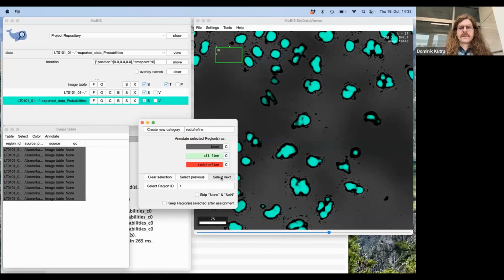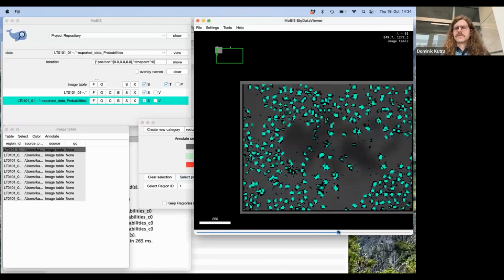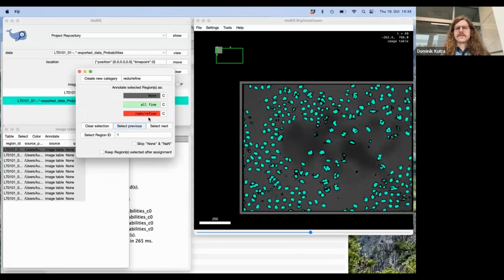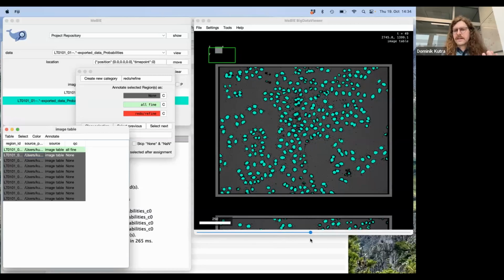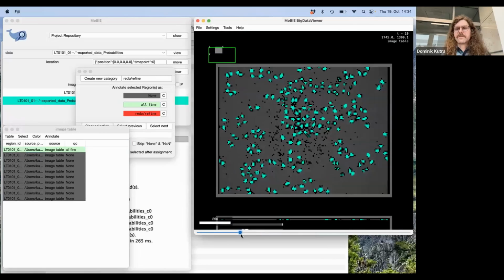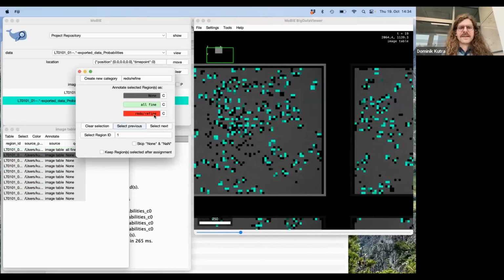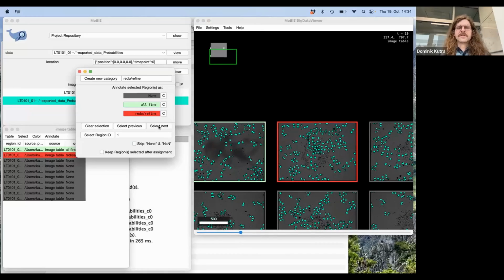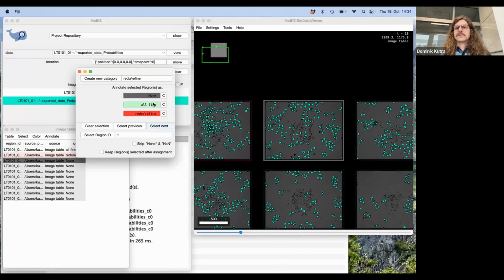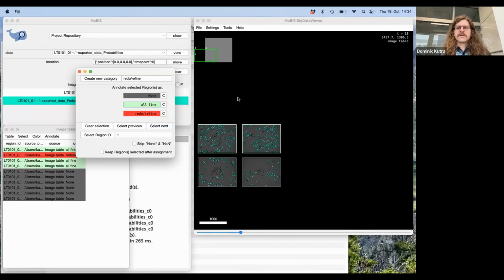Okay. And if you now go to this region, the idea is really you look through this image, and at some point you decide, okay, this is actually all fine. Then you click on the next one, and then again, of course, you have to inspect it, go through different time frames, decide whether all is good or not. Then click on the appropriate category. For example, here we could decide now this should be redone, and so MoBIE lets you do this in a really convenient and nice way, and you get this nice overview.